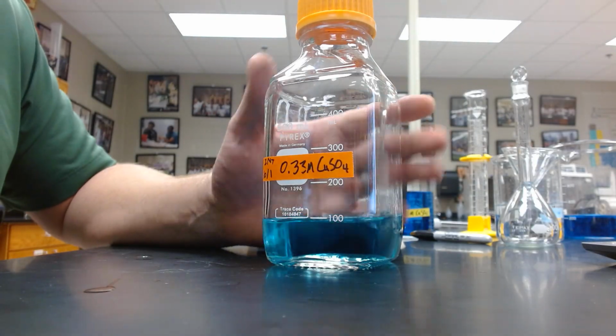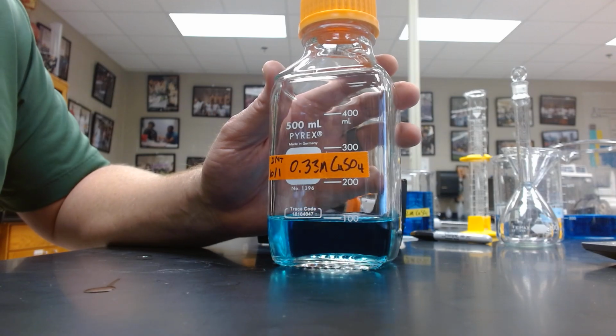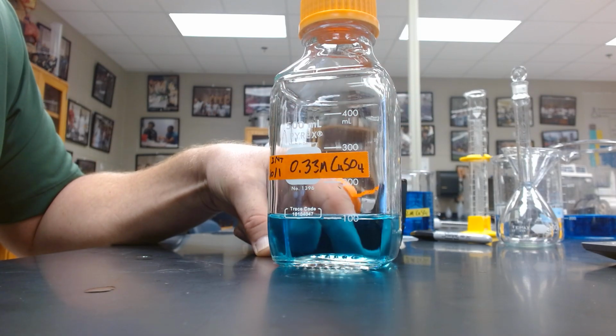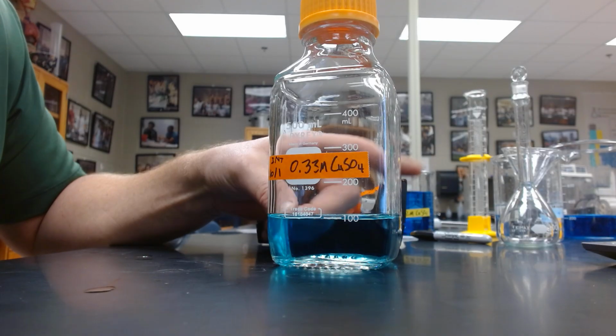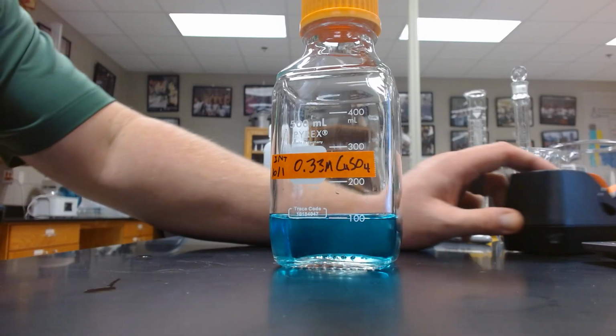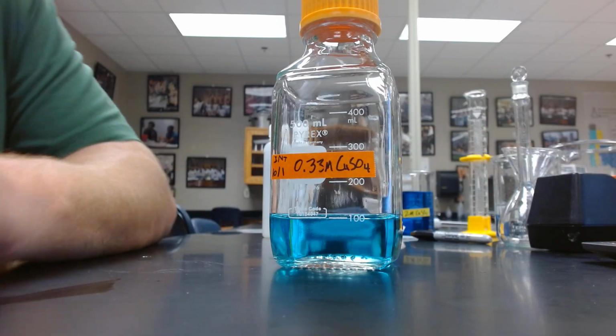So at this point we have completed the assignment. And the instructor will come over and check us off, and we'll check the concentration of the solution, most likely using spectrophotometry or something of that sort.